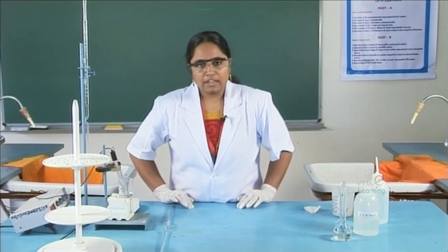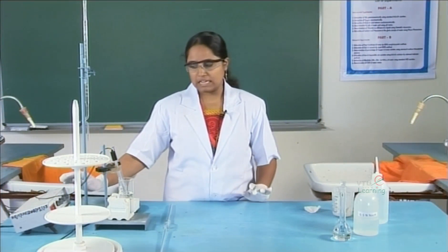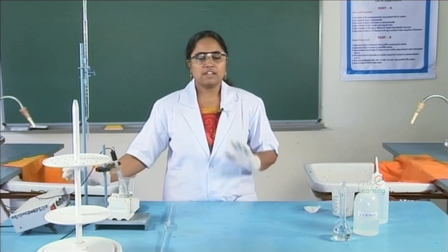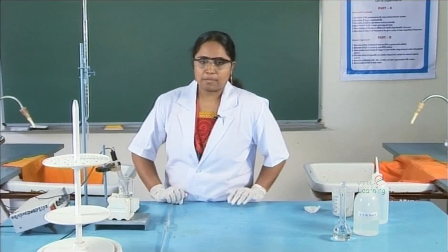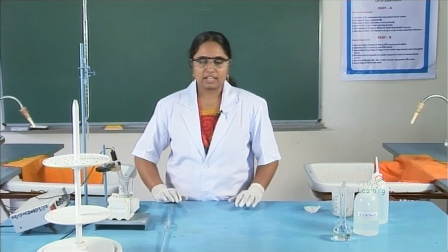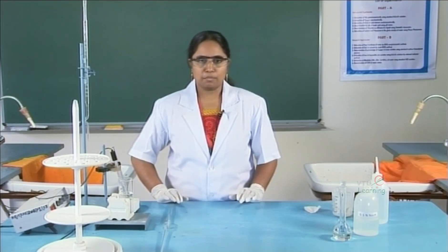Before carrying out this experiment, one important thing to note is that the digital potentiometer — that is, the pH meter — has to be standardized using a buffer solution of known pH.